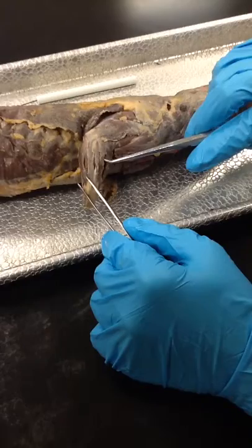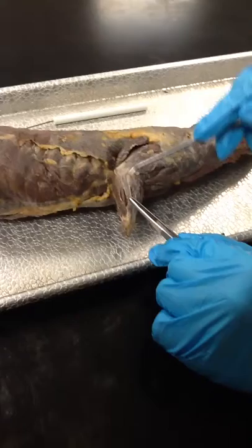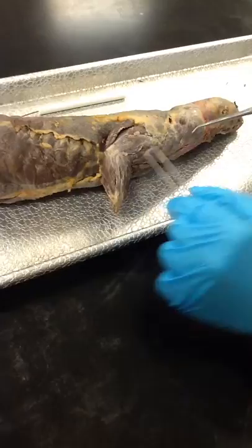Extensor carpi radialis longus. Right here is the abductor pollicis longus. Extensor digitorum communis. Extensor digitorum lateralis. Flexor carpi ulnaris. Extensor carpi ulnaris.